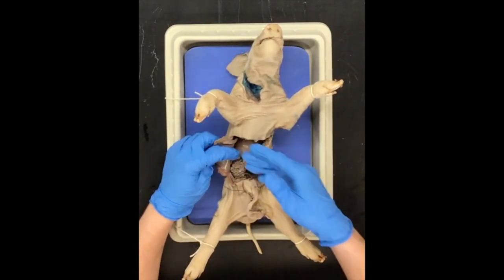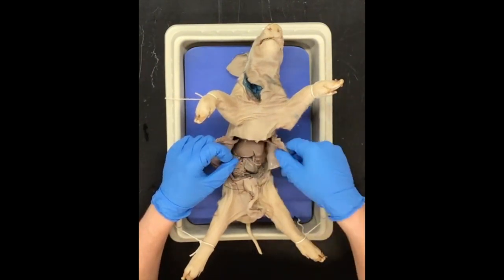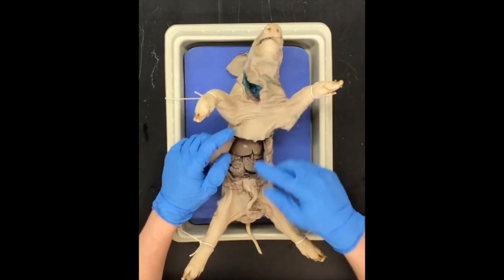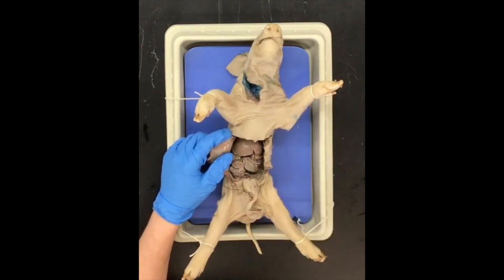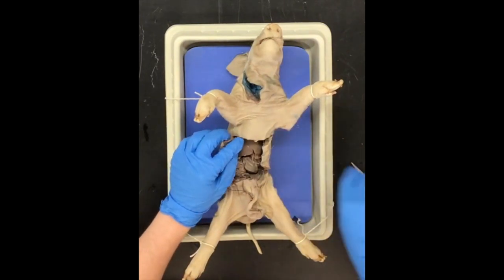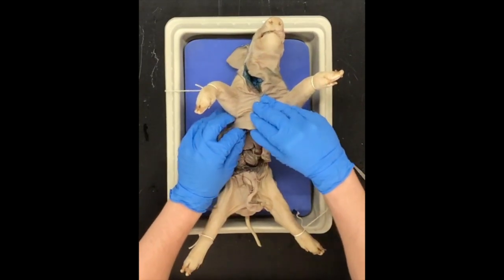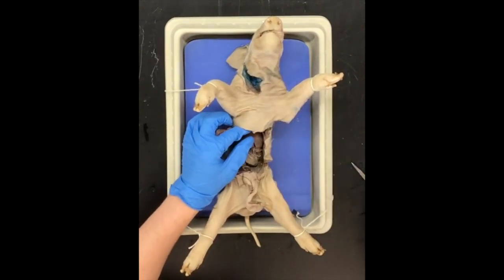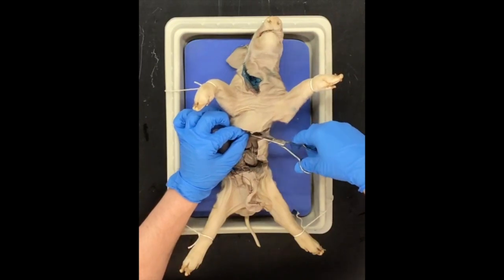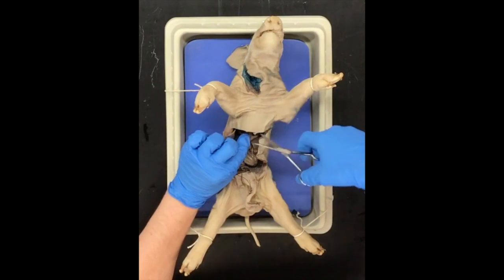So we've successfully removed some of the fluids from inside of the pig. Now we can kind of get access to some of these organs. I'm going to talk about some of these organs in a minute, but one organ I want you to pay close attention to is this flap right underneath here. Let me see if I can cut it free — there's this muscle flap right here.